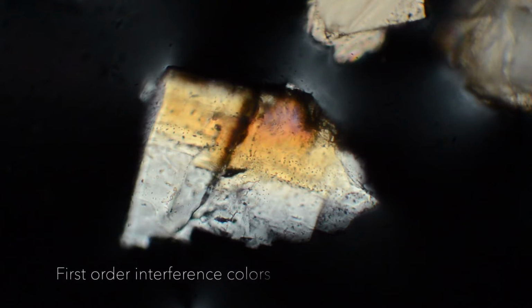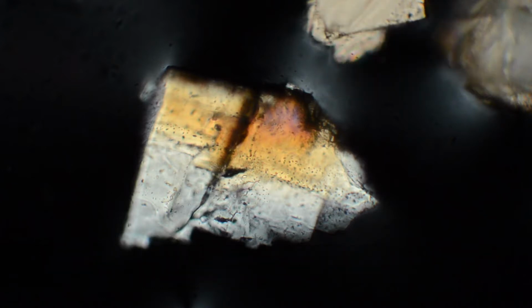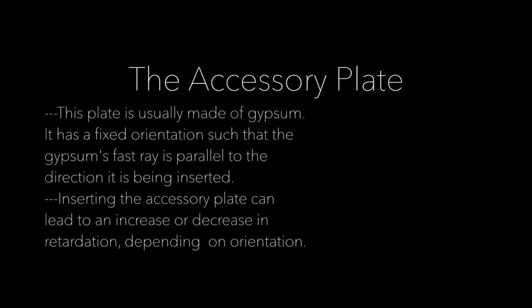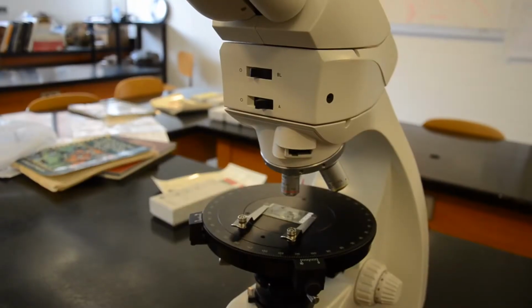Remember from the last video that interference colors are a product of retardation. Retardation is the amount that the slower ray lags behind the faster ray. In order to distinguish between the slow ray and the fast ray, we use an additional tool called the accessory plate. This plate is usually made of gypsum. It has a fixed orientation such that the gypsum's fast ray is parallel to the direction it is being inserted. Inserting the accessory plate can lead to an increase or decrease in retardation depending on orientation.